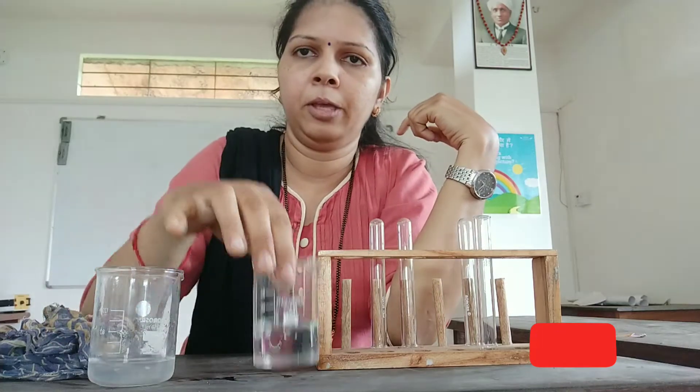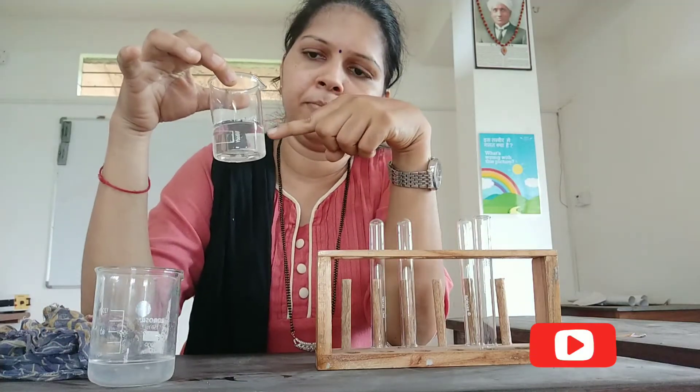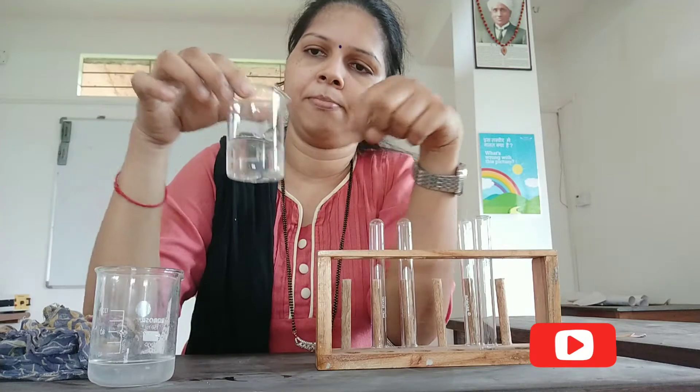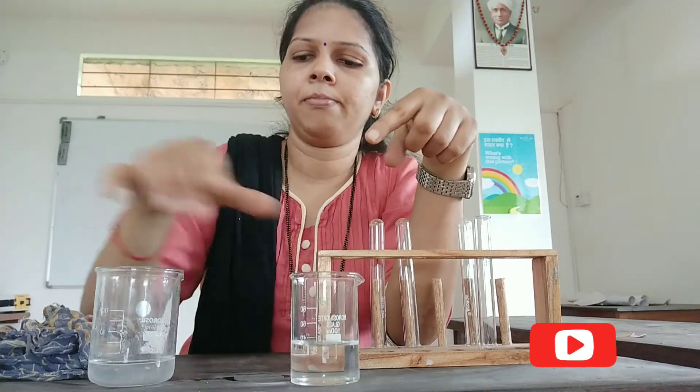What happens when potassium iodide and lead nitrate react with each other? Let's find out through this activity.